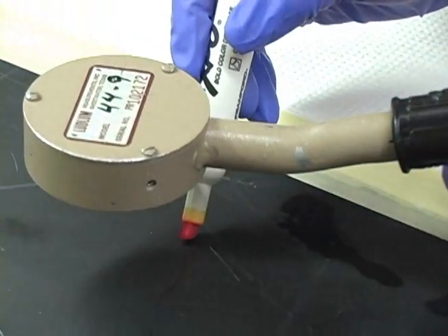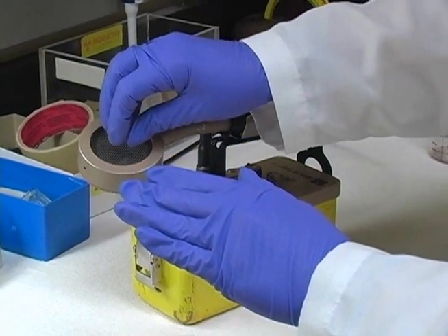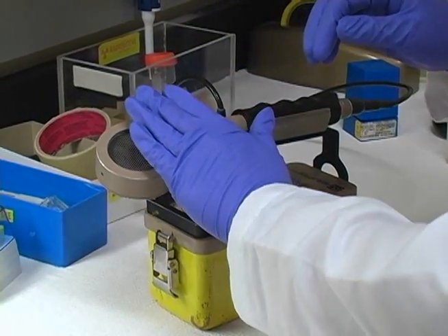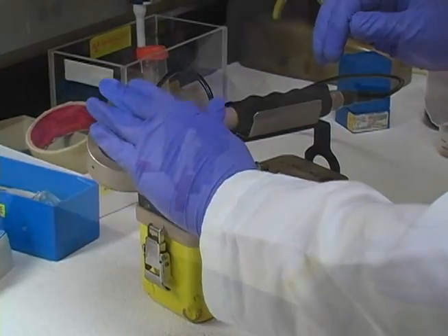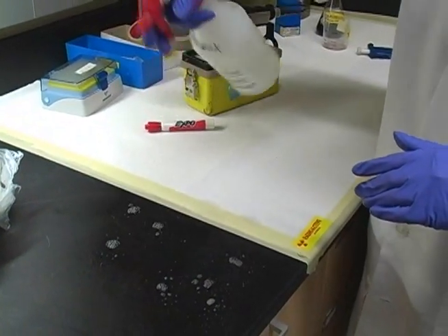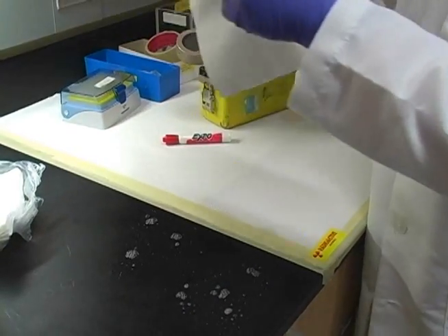Here we're checking the areas — again, frequently checking gloves. It's a slow process. You clean a little bit, you verify that material is coming up, and you do it again. Once it's clean and no more material is coming up, then you go to the next area.